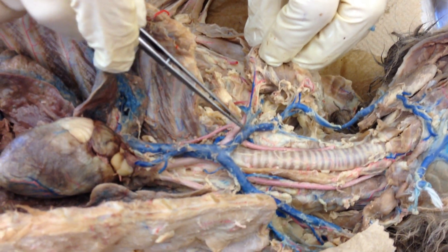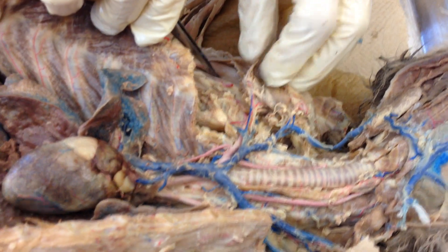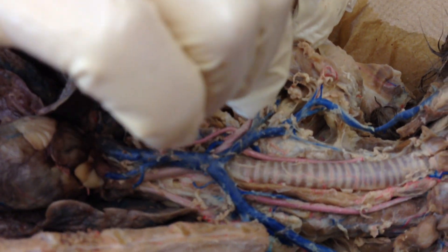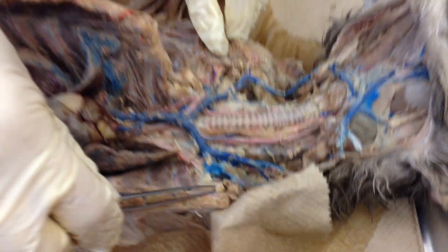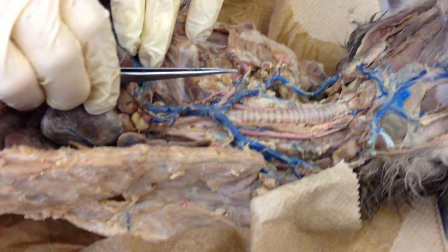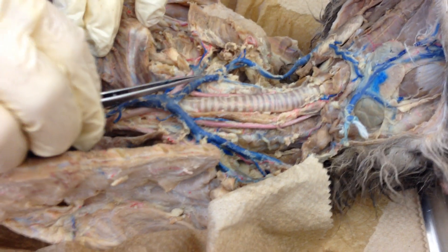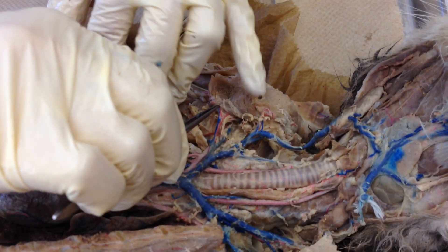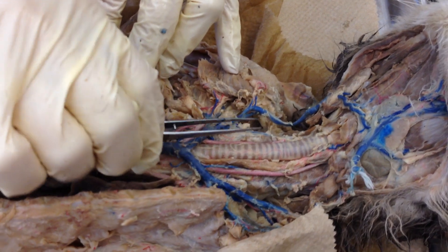So once again: brachiocephalic, subclavian, axillary, brachial. Right between them, this one is the subscapular — it's going down into the shoulder. So the superior vena cava branches into the right and left brachiocephalic. The brachiocephalic branches into the subclavian, axillary, and brachial going into the arm. The next branch is the subscapular. The ones going up to the neck are the external jugular, the internal jugular, and the transverse jugular.